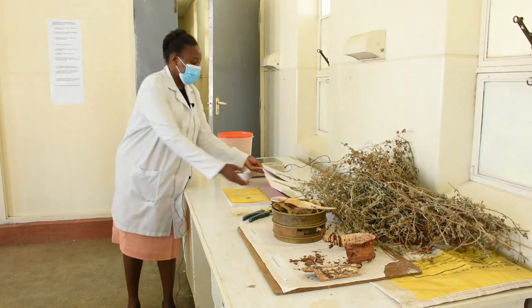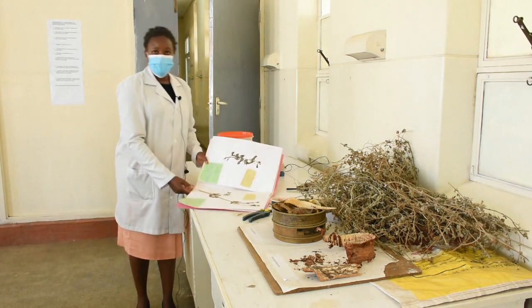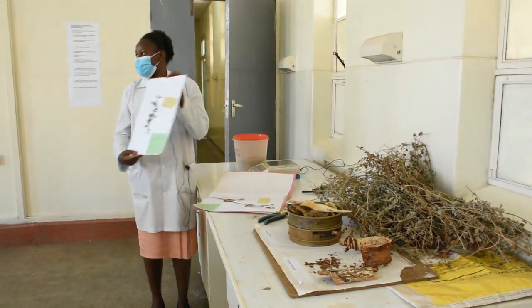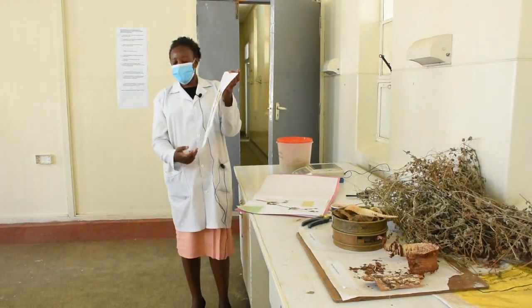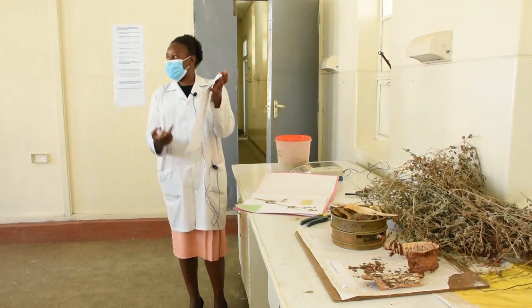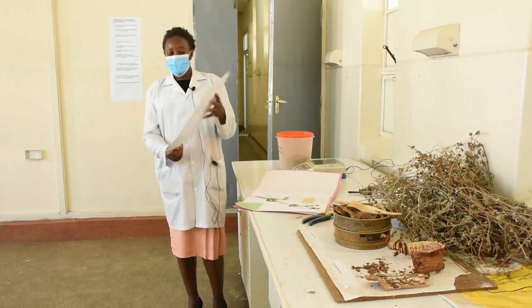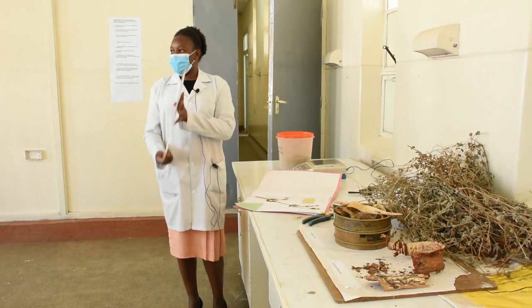Once we collect and press the plant, we have it identified to confirm plant identity, then prepare it as a herbarium specimen — with a description including who collected it, where it was collected, the botanical name, and the date collected. This forms a basis for future reference.